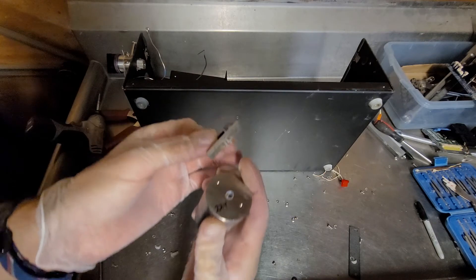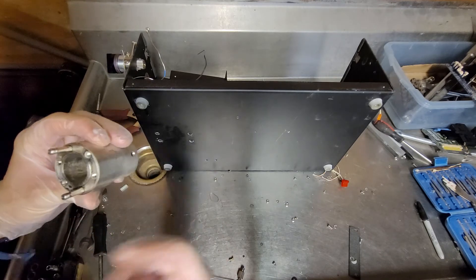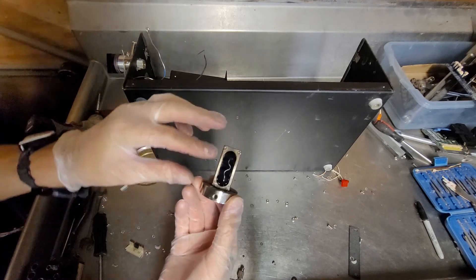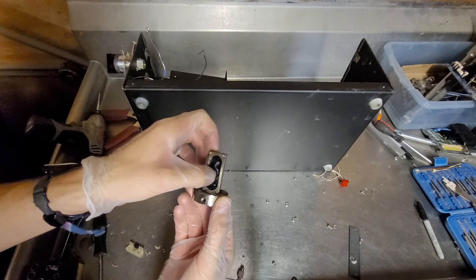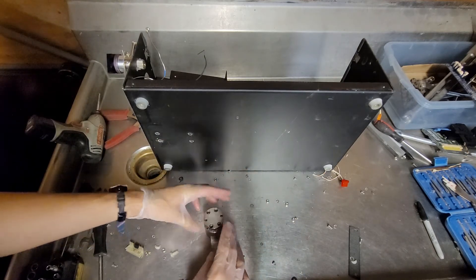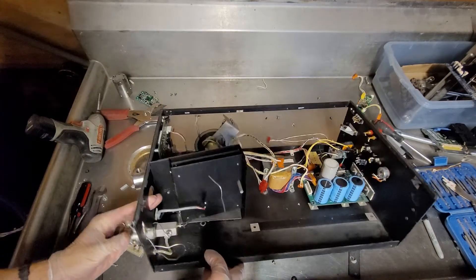Just some pins that feed into there. I'm guessing this is a motor. I probably shouldn't be sticking my finger in there — I don't know where I punctured my gloves. But taking that apart was a bit of a mistake. It's out of my way now and most of the liquid evaporated.